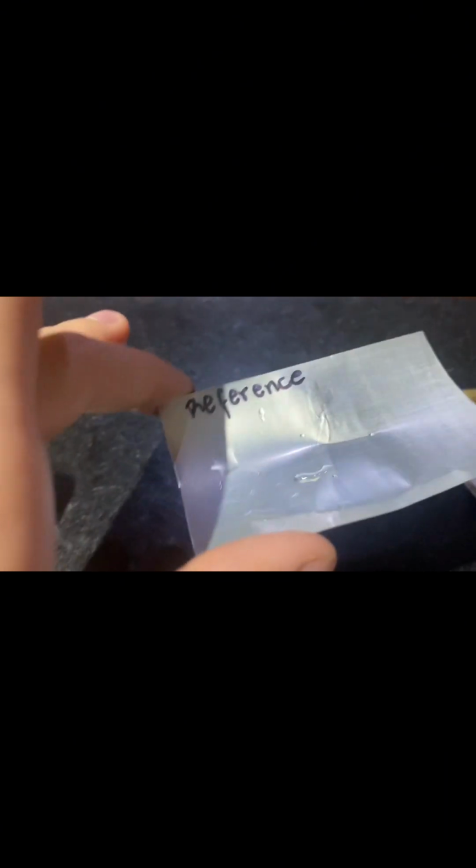In the reference sample, we can see that this aluminum can has not undergone any special thermal treatment. Aluminum in its initial state has a crystal structure typical of metals, with atoms arranged in a regular pattern. This initial state is not considered in the annealing structure, so nothing is going to happen.